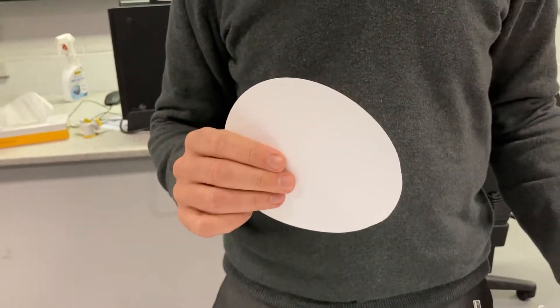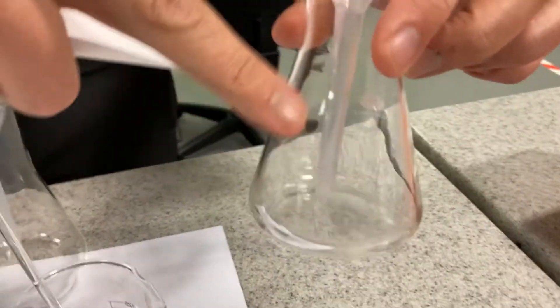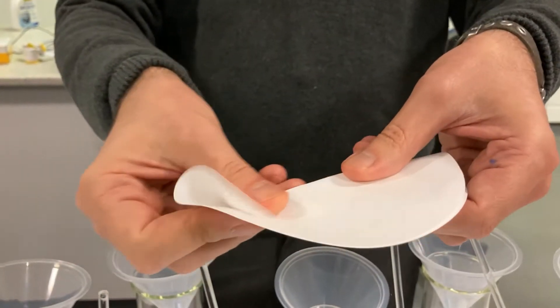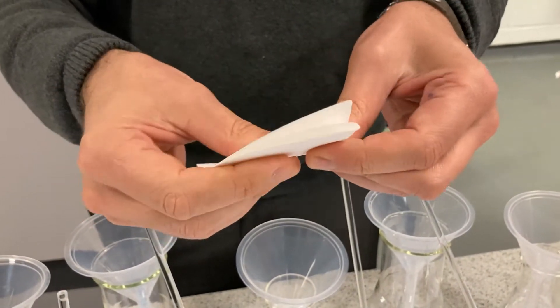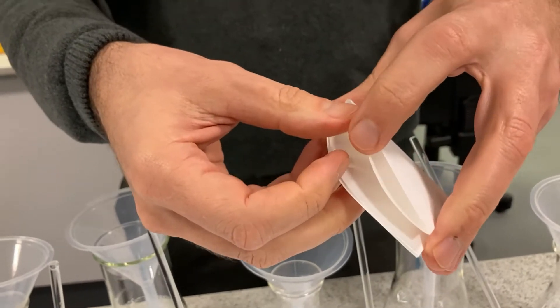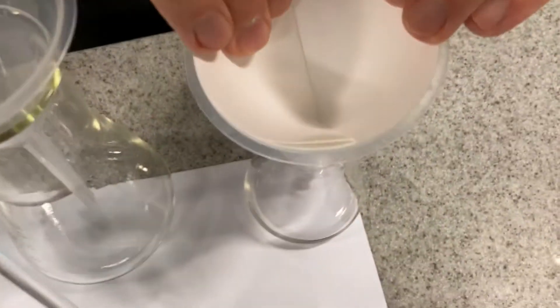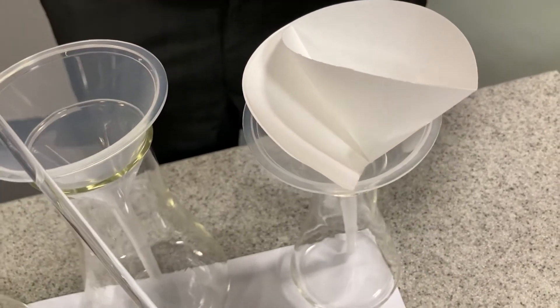Now we're going to see which of those solutions will go through a piece of filter paper. We're going to use a conical flask and a funnel and put the filter paper into the funnel. To fold the filter paper: fold it to a quarter, then open it up so you have three bits of paper on one side and one bit on the other side. It goes into the funnel and should stay there — especially when it's wet, it'll stay put.